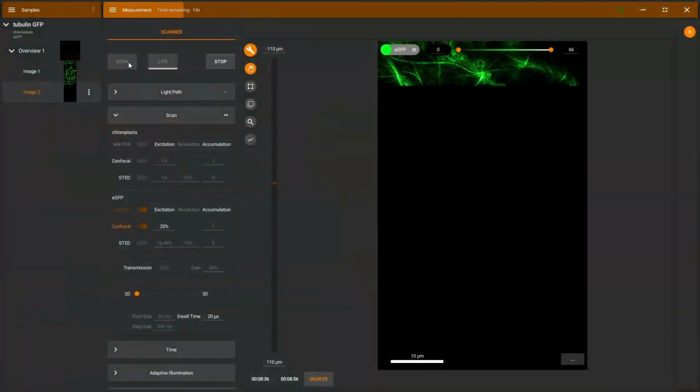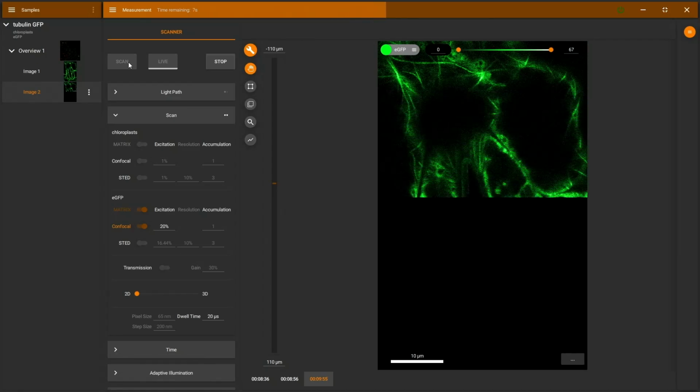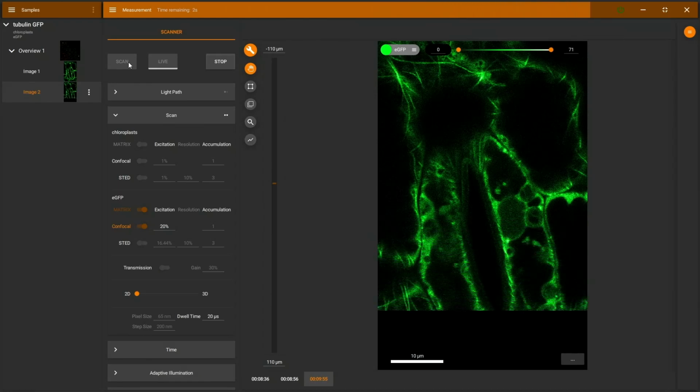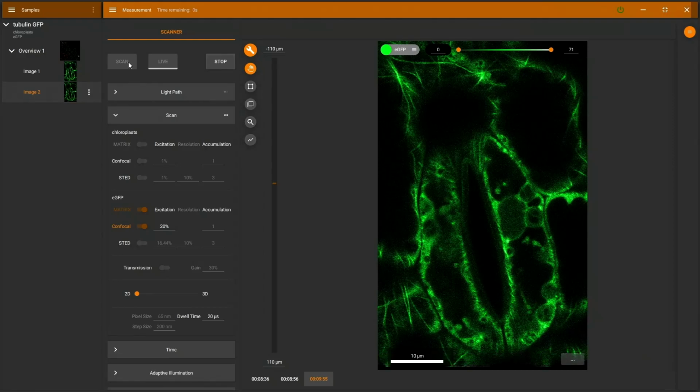However, I will then get an image which is just as sharp as an image recorded with a very small pinhole. And this is possible because the matrix detector can decide what of all this light is in focus and what is out of focus. Basically, we're not wasting fluorescence, but we are also increasing the resolution. Here you can see already an image when we are acquiring the matrix image.